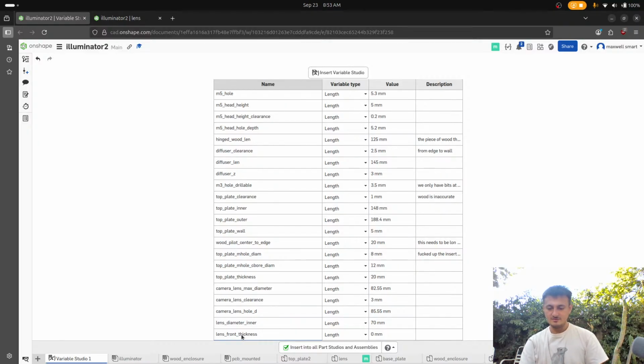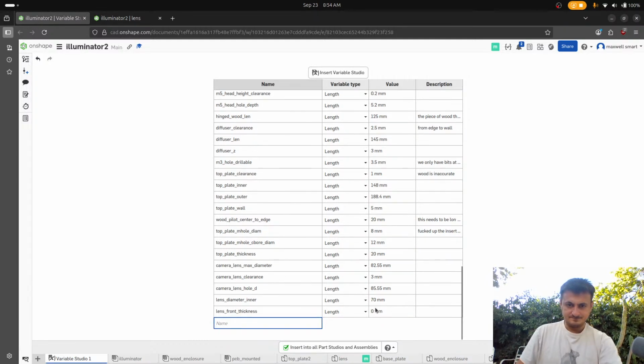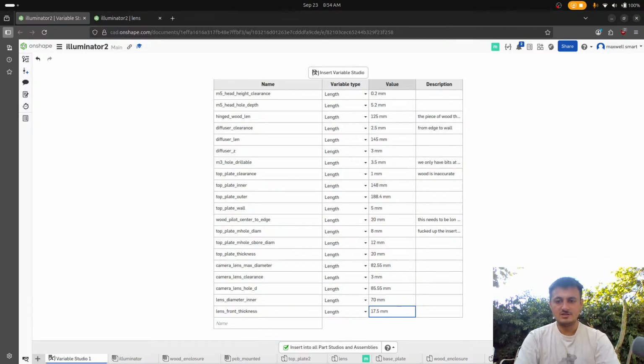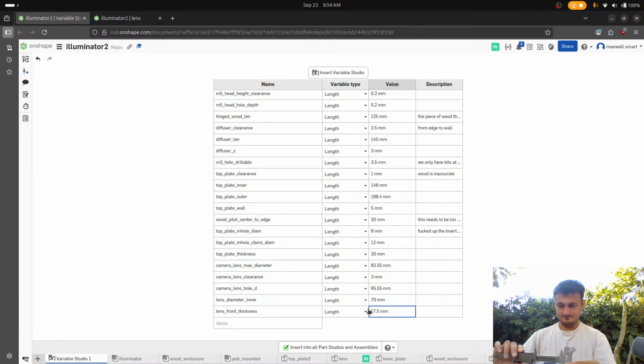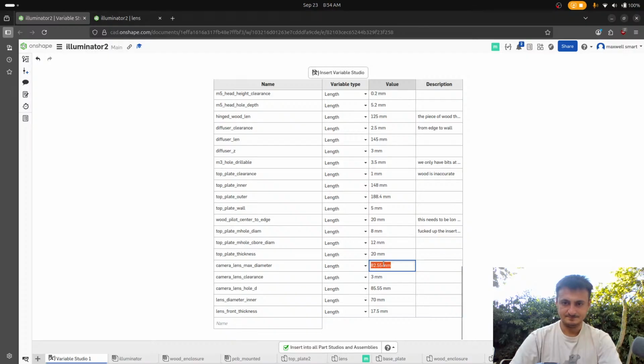So effectively, we are going to treat, okay, so, lens front thickness is 17.5. And that's going to be a diameter of, I think, 83, right? I'm going to change this to 82.75. That's the closer number that I'm getting.